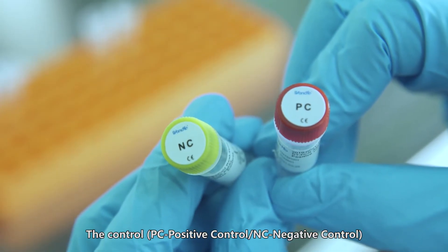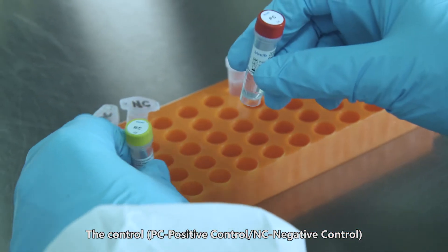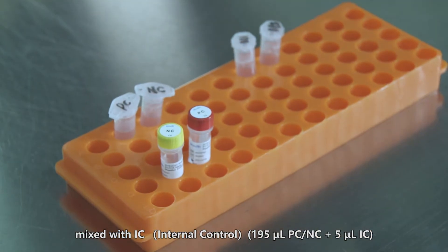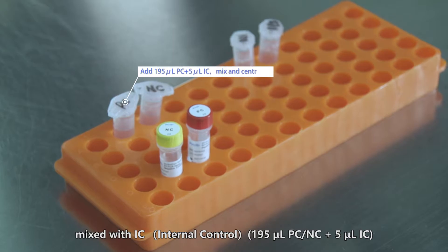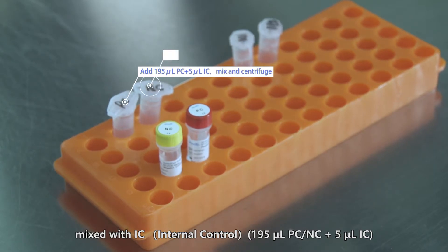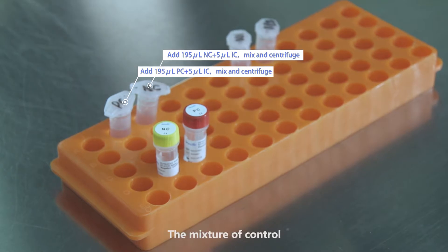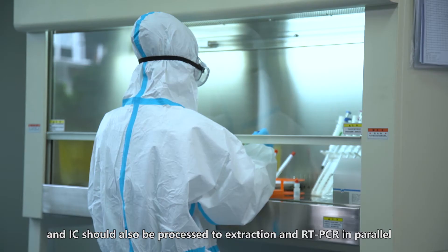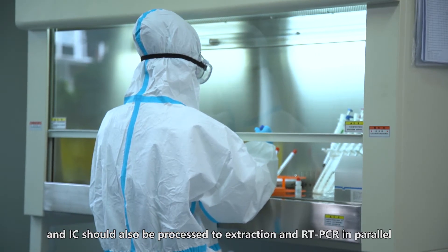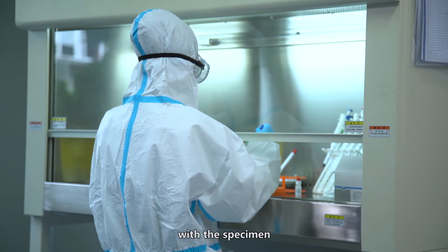The controls — PC positive control and NC negative control — are mixed with IC: 195 µL PC and NC plus 5 µL IC respectively. The mixture of control and IC should also be processed through extraction and RT-PCR in parallel with the specimen.